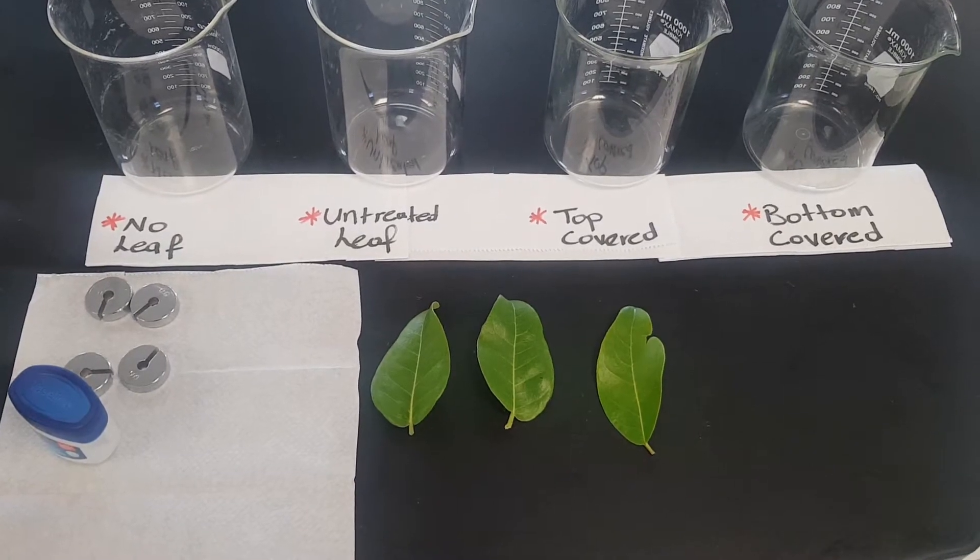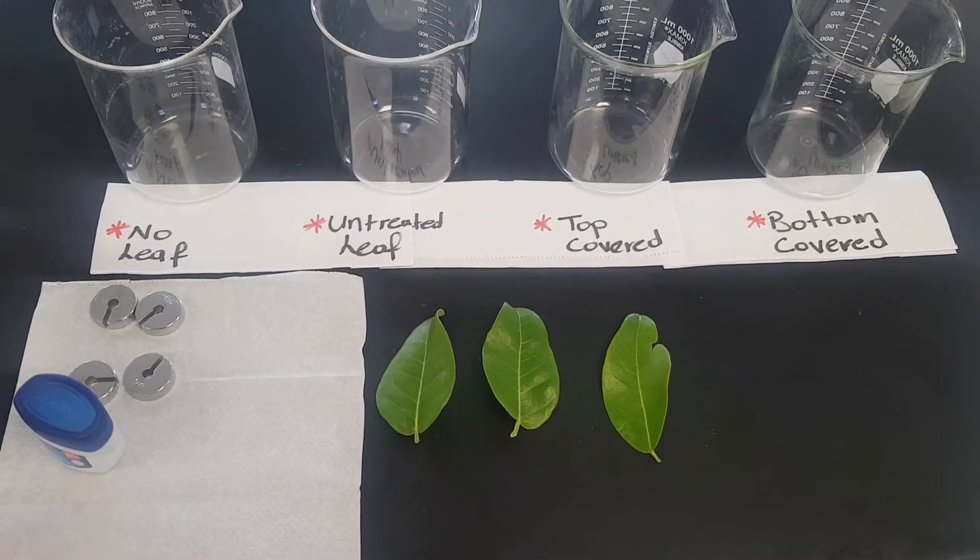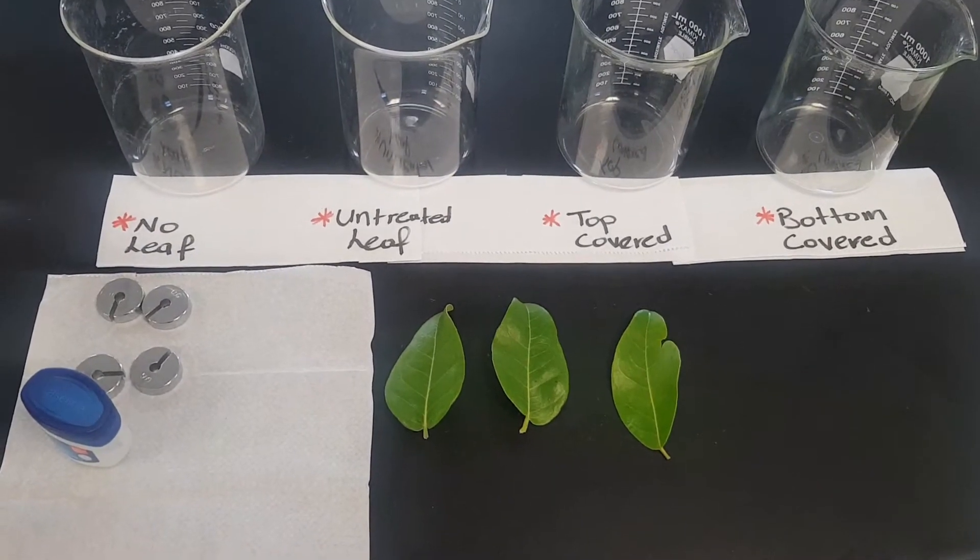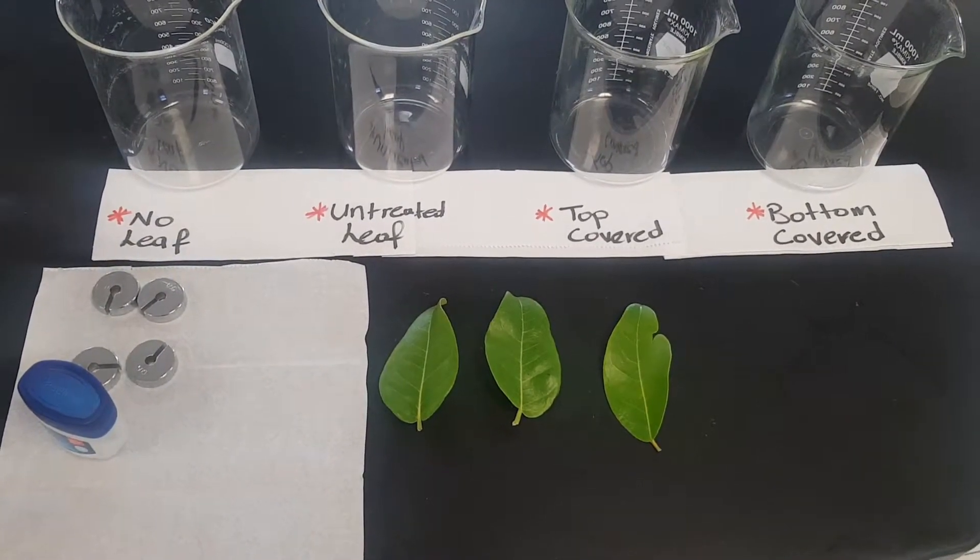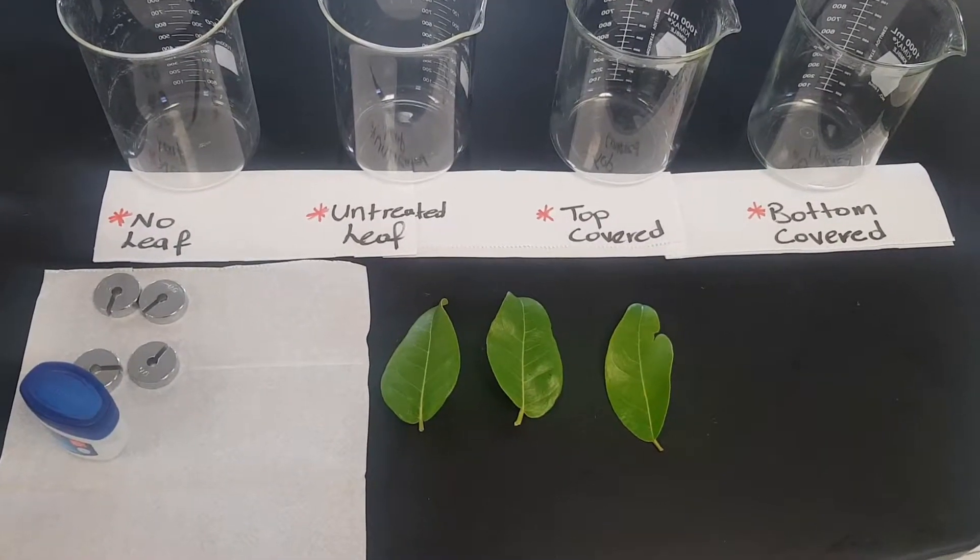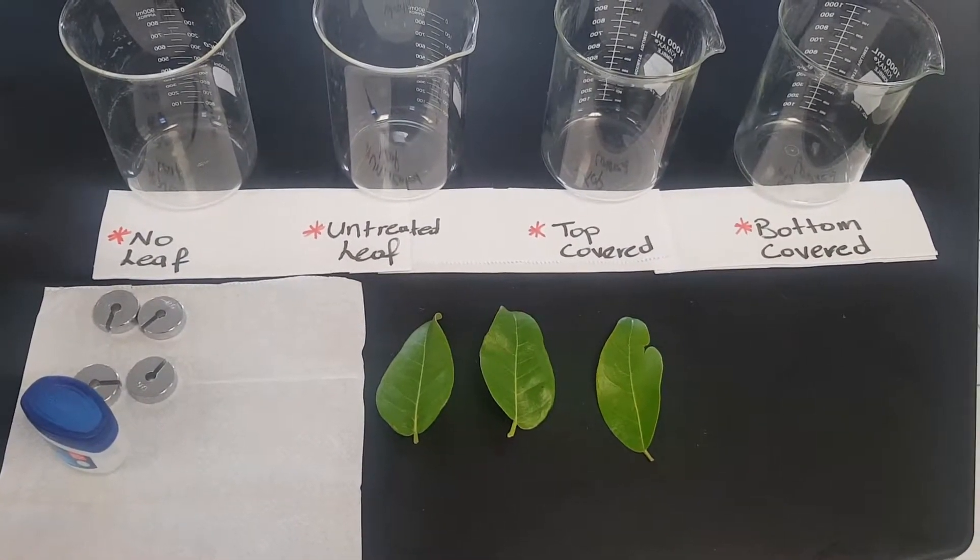Today's experiment is to determine which side of the leaf produces the most oxygen or which side of the leaf has the most stomata.